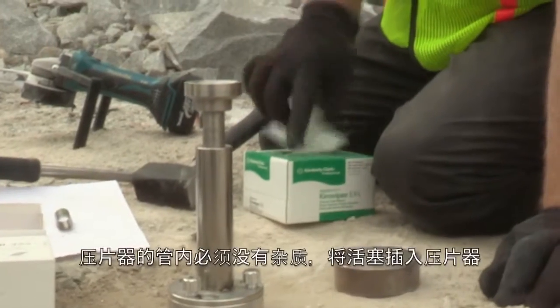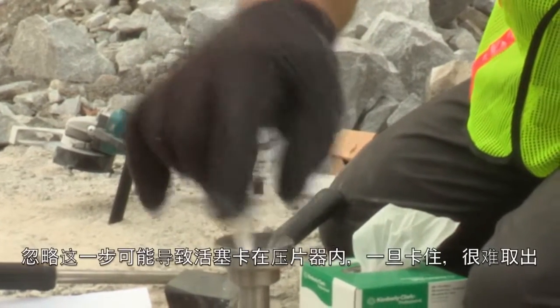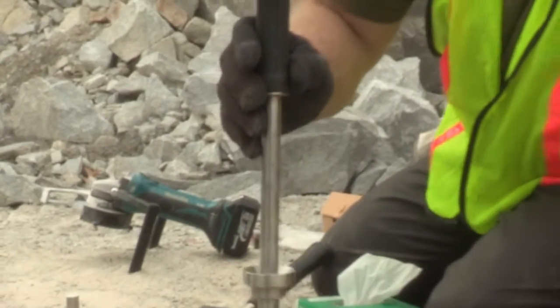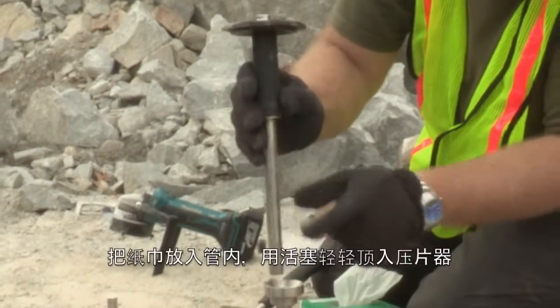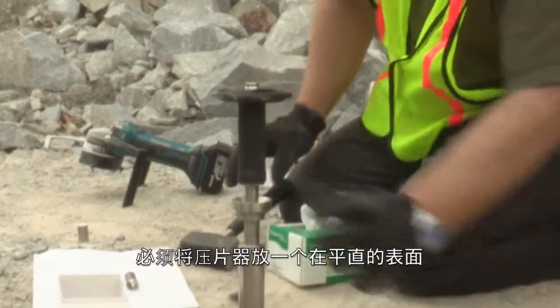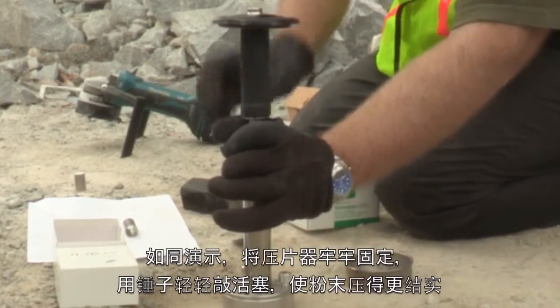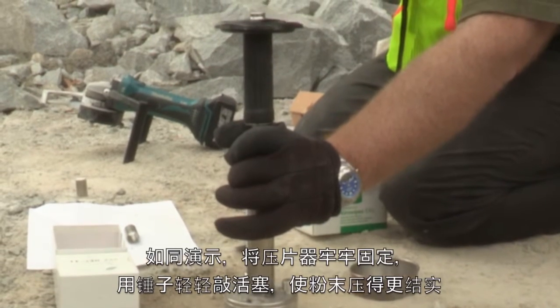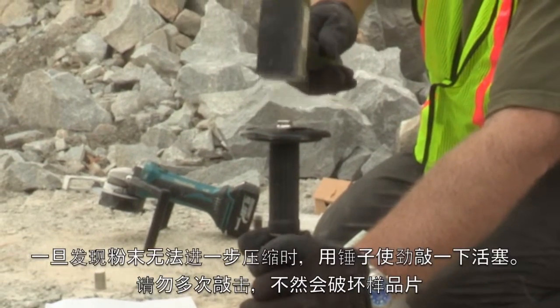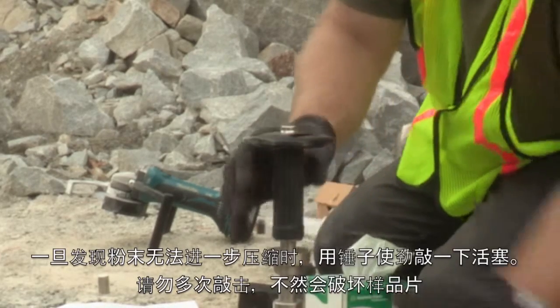The inside of the pellet tube must be free of powder before the piston is inserted in the press. Skipping this step may result in the piston getting stuck in the pellet press, and it can be very difficult to remove. Gently move the tissue down the tube with the piston. You must make sure the pellet press is on a firm surface. Firmly hold the pellet press as shown. Gently tap the piston with the hammer to further compact the material. Then, once the material does not seem to compress anymore, give the piston one solid blow with the hammer. Do not hit the pellet multiple times or you will destroy the pellet.